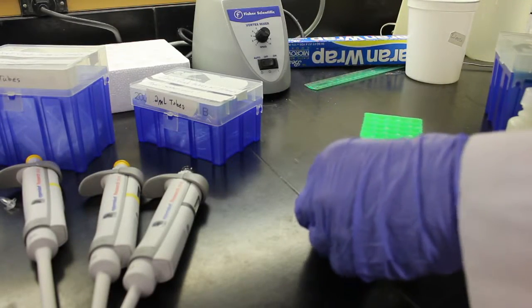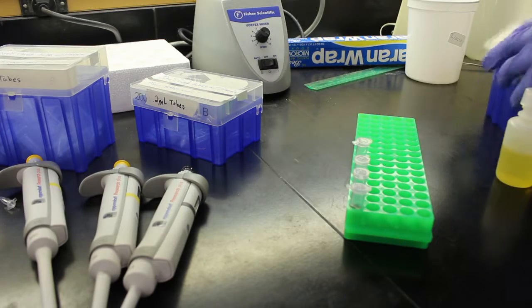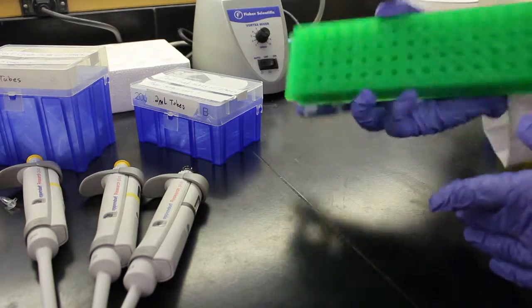Next, add 400 microliters of P3 buffer, which should be stored in a 4 degrees Celsius fridge, and mix thoroughly.